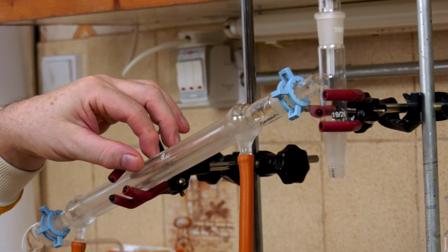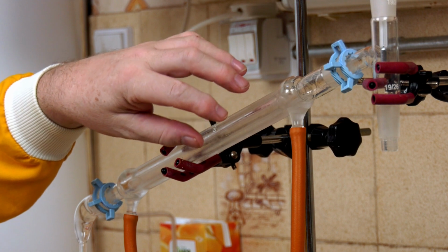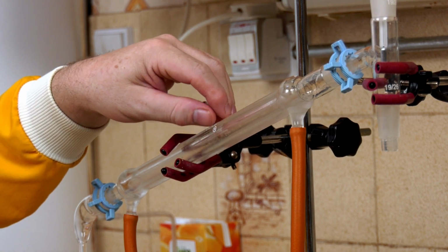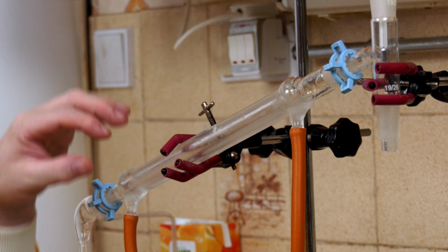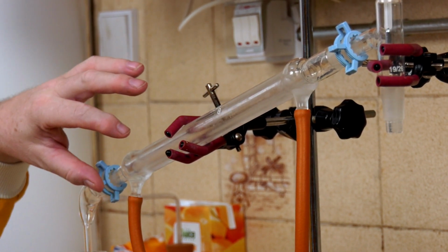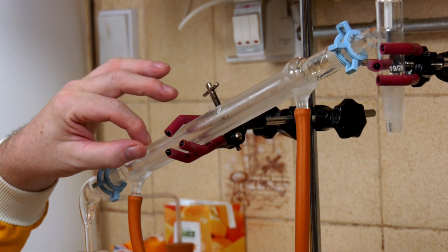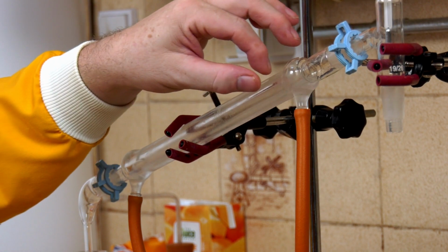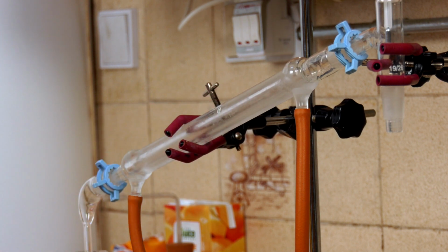Here we've got colder water, and this gas, or maybe even liquid by then, is also colder, so this will manage to take the heat away from that. And at the bottom we've got the coldest water, and we're meeting the coldest liquid or gas, and that's going to cool it down. So all the way along it's actually going to cool, because the water will be cooler than the gas or liquid coming down the tube.